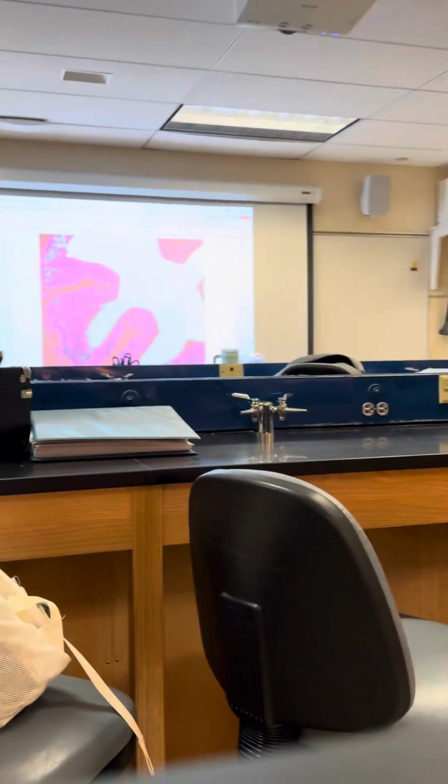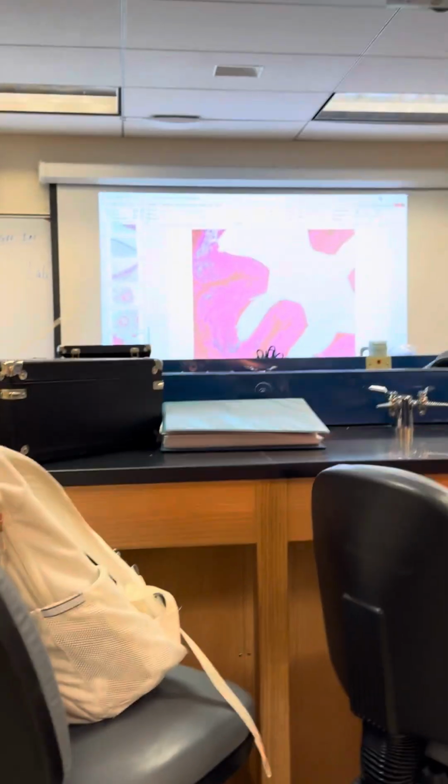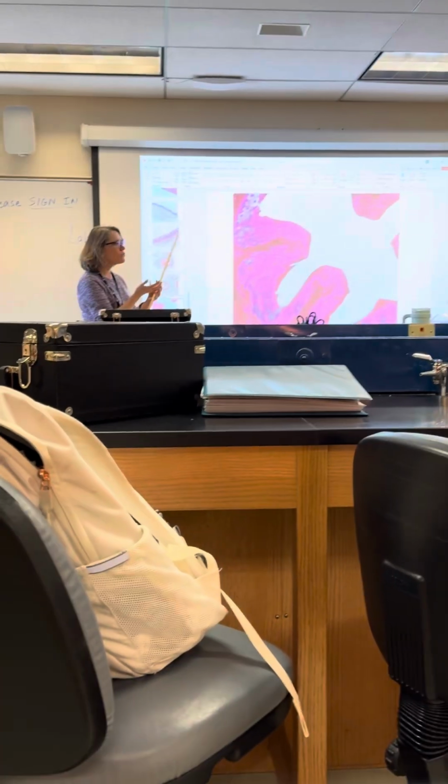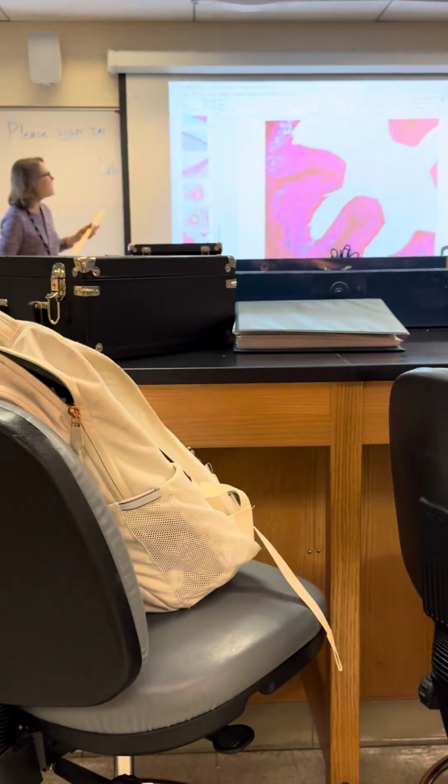So what kind of epithelium is here? This is a transitional epithelial tissue. This is in the ureter. So what is its function? Yeah, distension, stretching. Stretch, rebound. I'll show you another slide that I use that's a little closer to the one in the lab manual. It's actually in the urinary bladder.